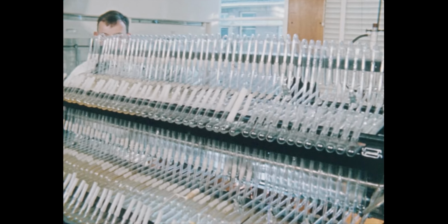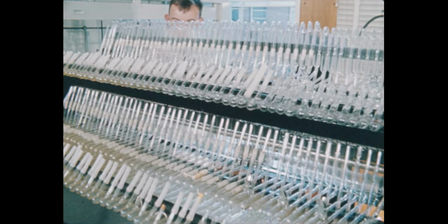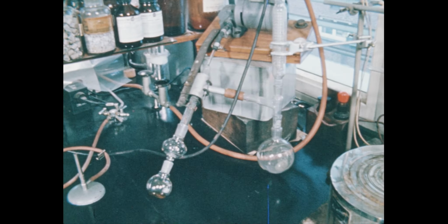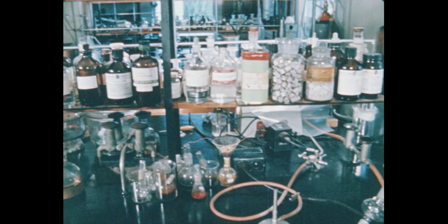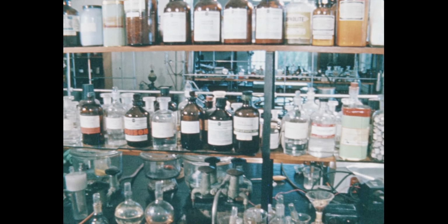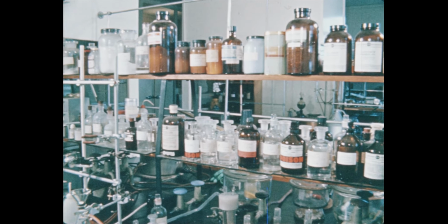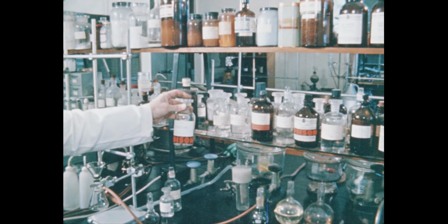The chemical laboratory has an element of danger which is often underestimated, especially where new chemicals and new reactions are quite normal features. Everything that is used in a chemical laboratory should therefore be treated with respect, for while it's well known that some chemicals are dangerous, other chemicals, notably among the common solvents, may be even more dangerous and yet be thought practically harmless.